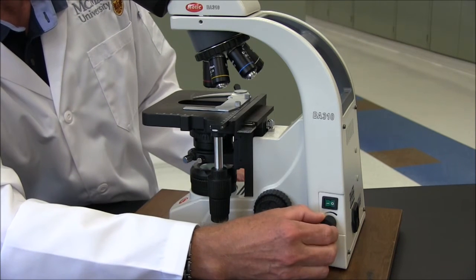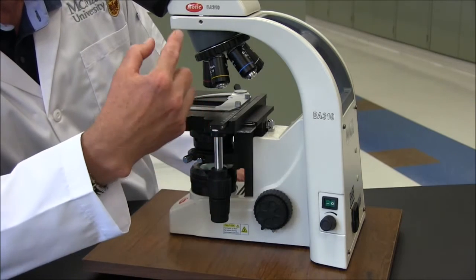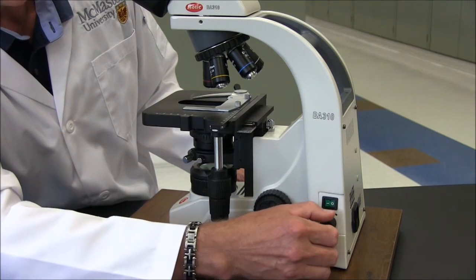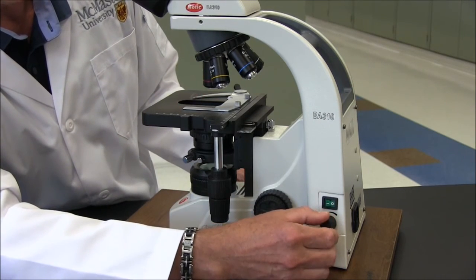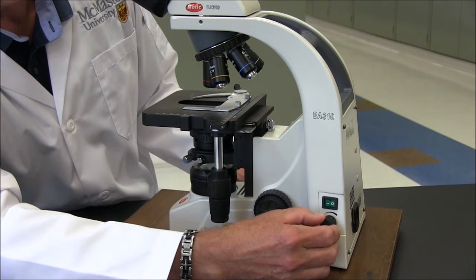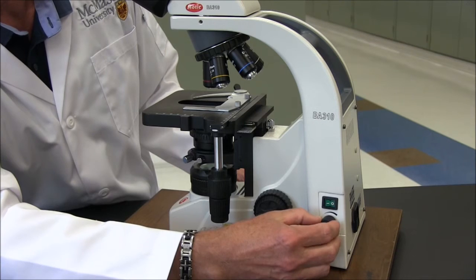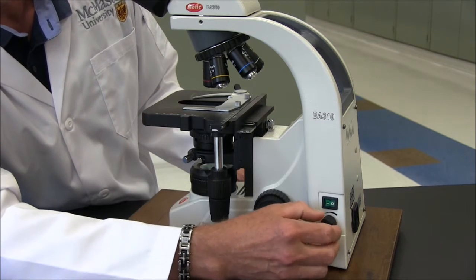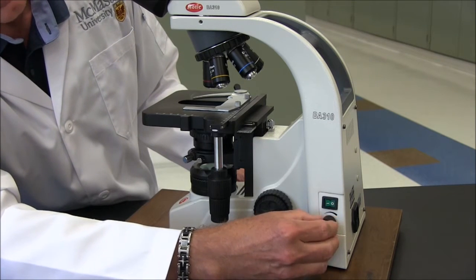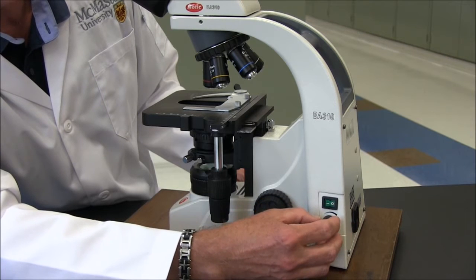A lot of people think this is the best way to increase the intensity of light that's going to your eyes, but all it does is actually increase the intensity of the lamp, not the quality of the light. As your lamp ages, you need to increase this to get the same amount of light at the other end. The best setting for this is about halfway on the scale when you first turn on your microscope.